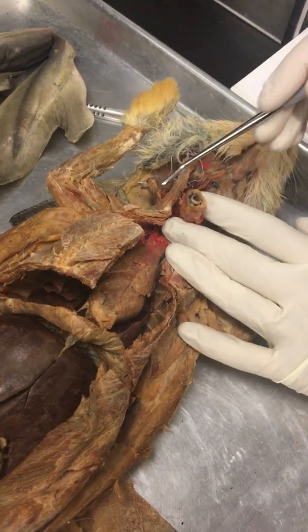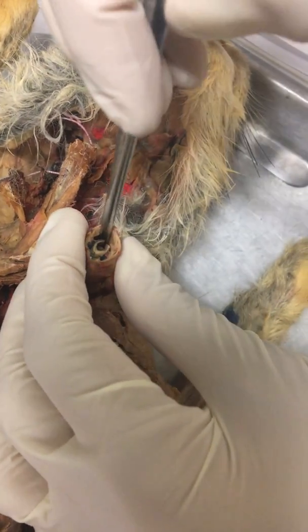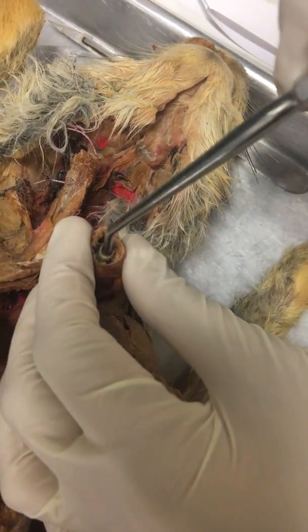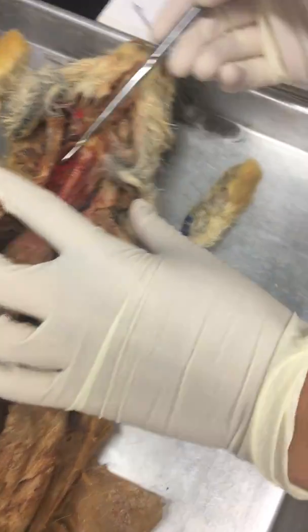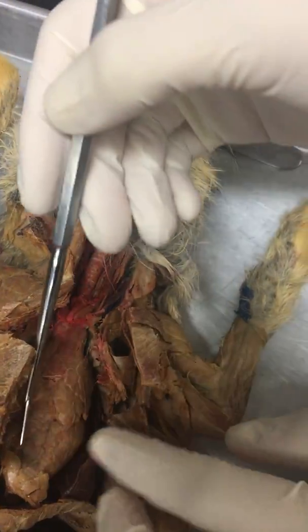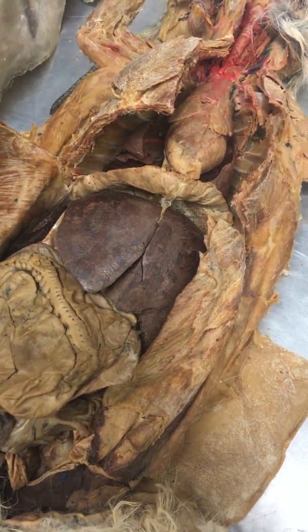Then if you look here, the esophagus is more dorsal, so that's this hole right here. And then the trachea is this hard round one there. And you can see the trachea going down here, the cartilage. And then the esophagus leads down, and you get to the stomach. But I can do the lungs since that's kind of next.